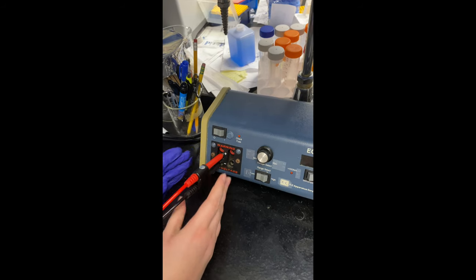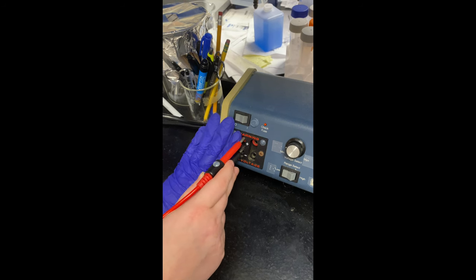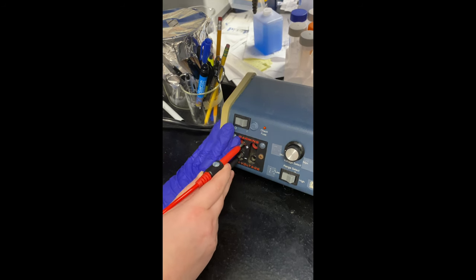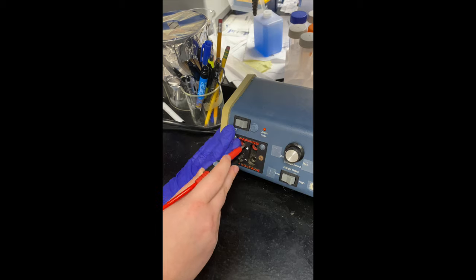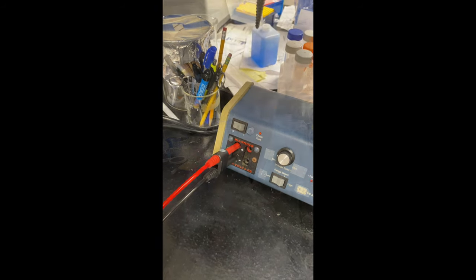Stay positive my friends. Oh, I think I had to pull it up a little bit. It's not all the way in there, it's just kind of wedged in the wrong spot. There we go. I think that's the right area. Got it. Gel loading guide practice, gel electrophoresis part four.